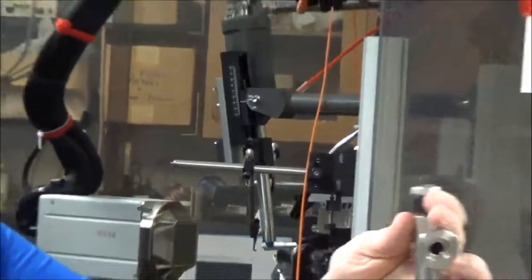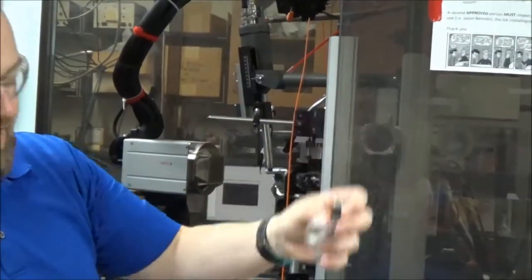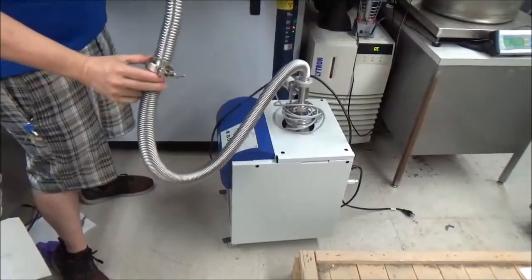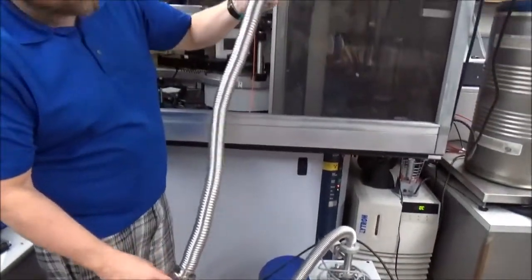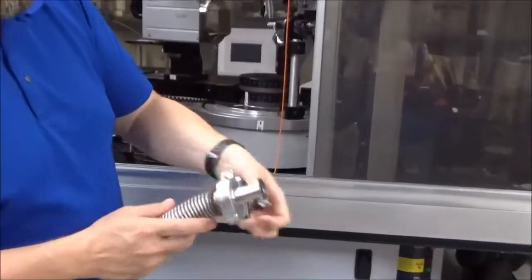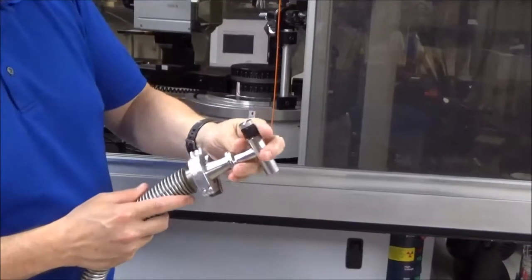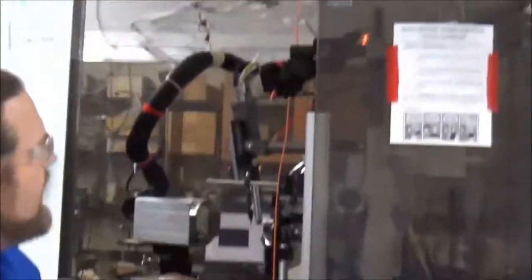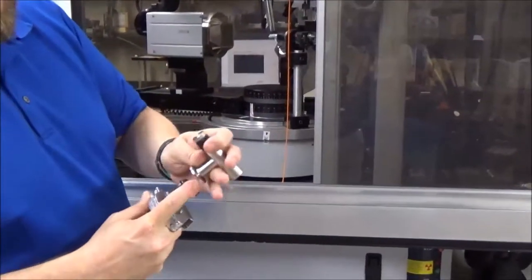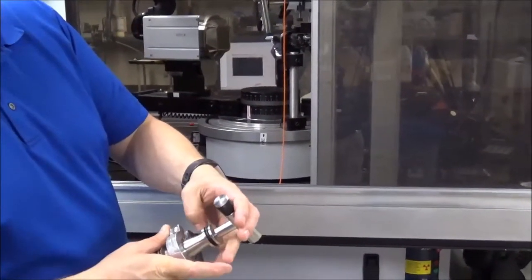So what we need is our device to screw onto the top of the cold head. We need this vacuum pump. We've got two segments of the hose on it, and then this reducing portion. And so that'll let us make this connection once this thing is hooked up. And of course, to make that connection, we'll need another one of these spacers.